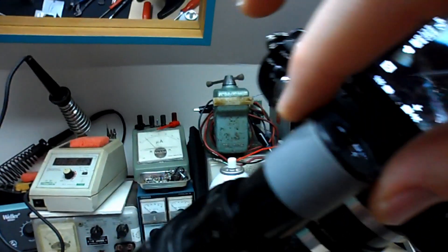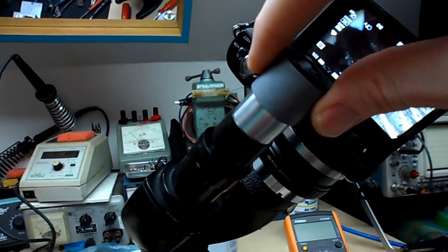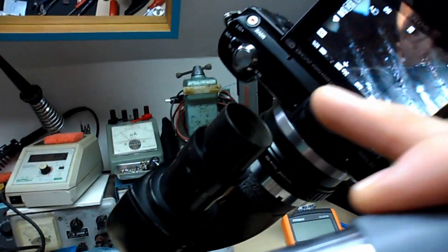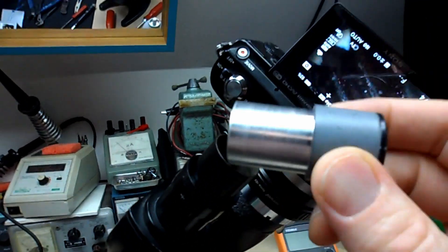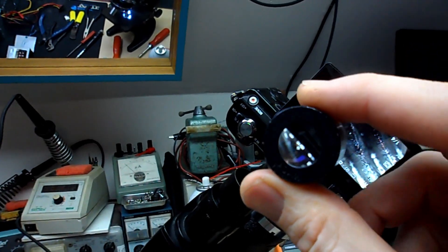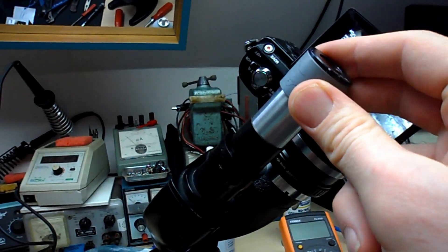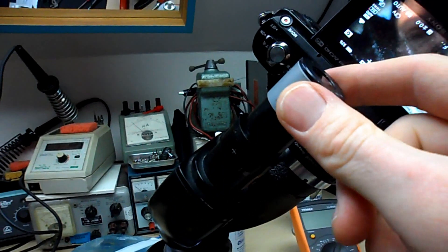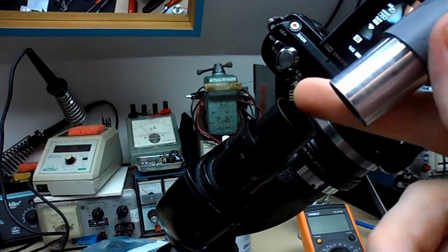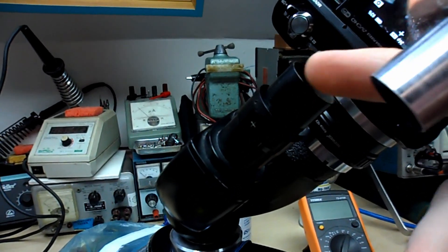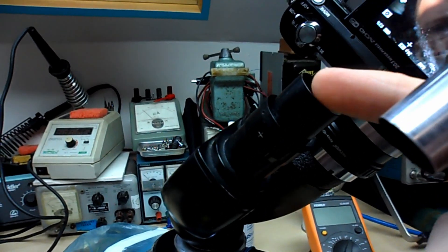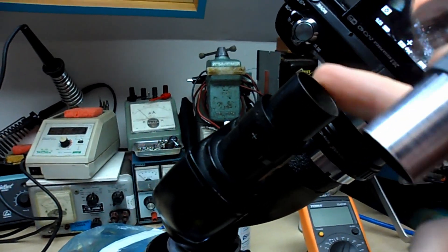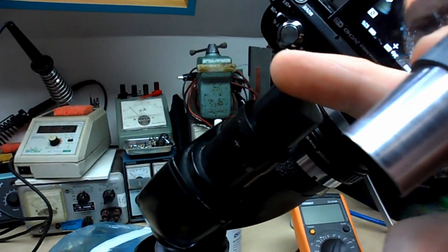For a modern microscope you can buy basically a webcam in a sense that just goes down into the tube. But the diameter of the tube is everything and this is older and this is smaller. It's only about I think 19 millimeters on the outside.